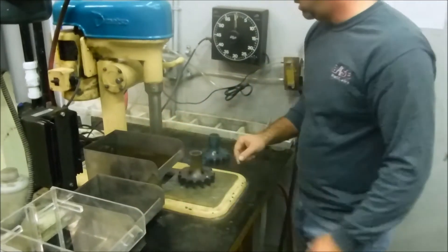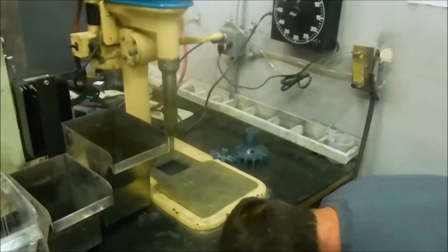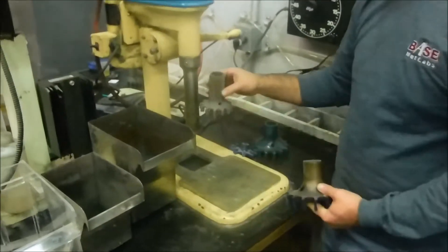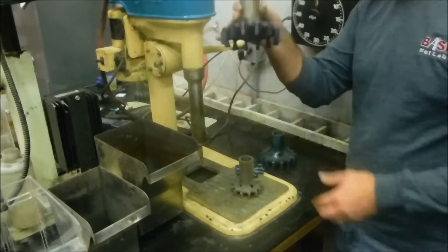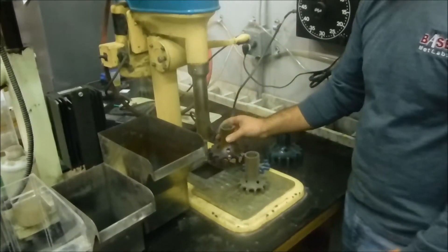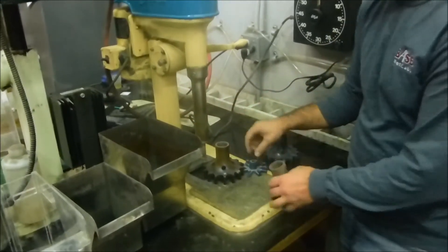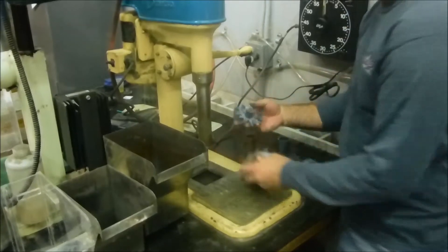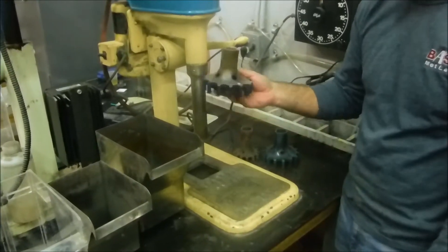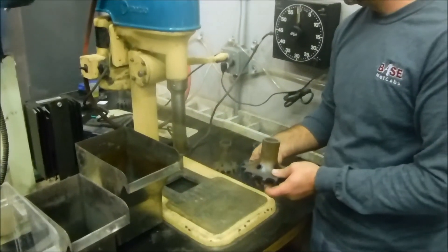On the Metso agitator, there's usually two different sizes of diffuser and agitator. These are the diffusers. They thread onto the bottom of the impeller shaft, and then the impeller goes on after underneath. This is the impeller for the larger cell. This would be the one that we run most often with the 4.4 litre cell.